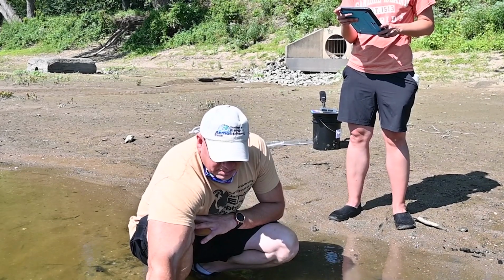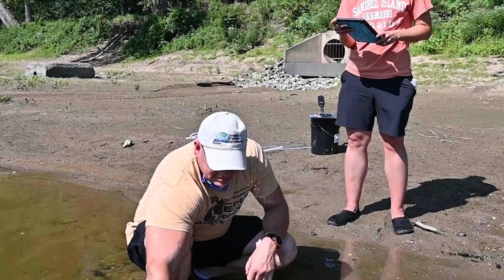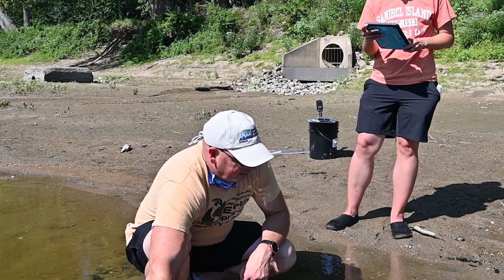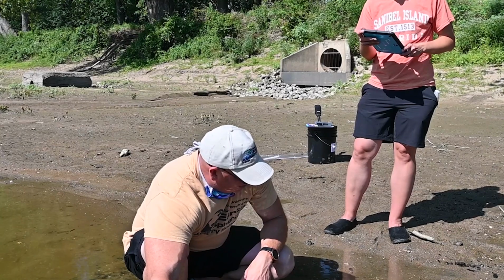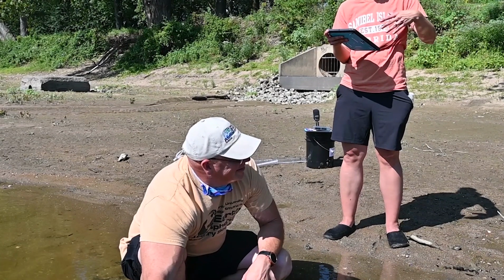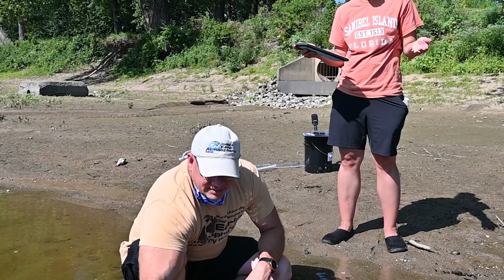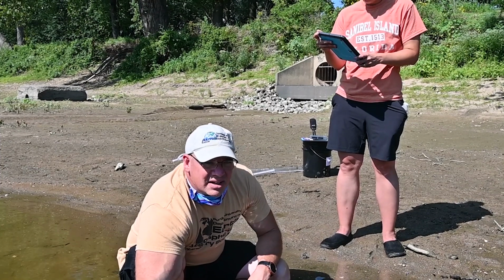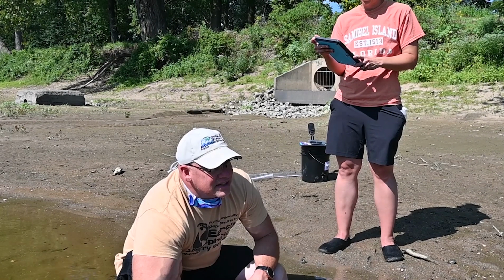There's a bunch of little minnows or little fish trying to bite my thermometer. I see them. So it's just dropped a full degree. We're down to 27 degrees Celsius. We're probably going to have to wait a couple minutes here for that to settle, aren't we? That's right. When we take our temperature reading out here at the river, the protocol is you would wait 3 minutes. Okay, so we'll wait 3 minutes and let it settle and figure out what it really is.